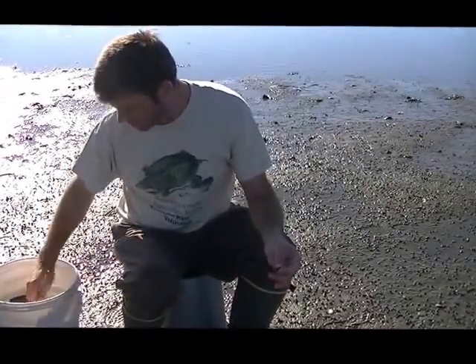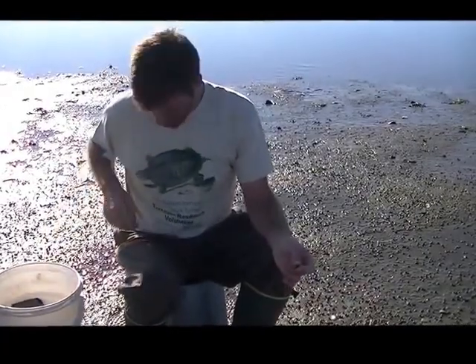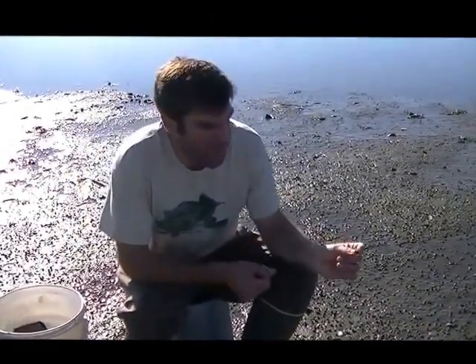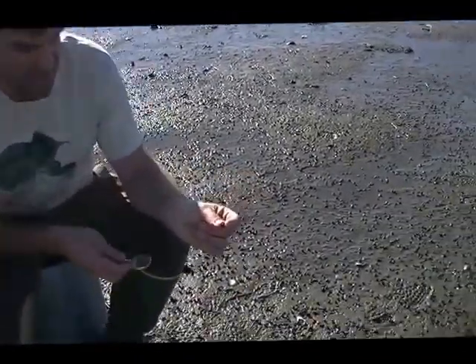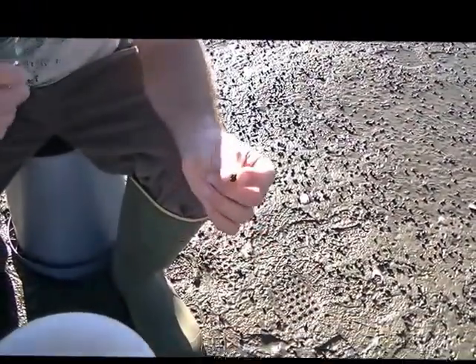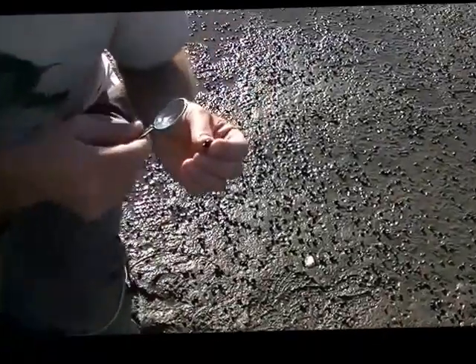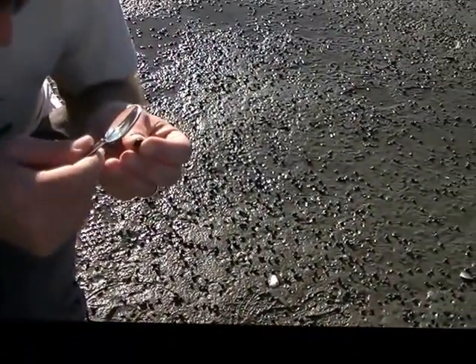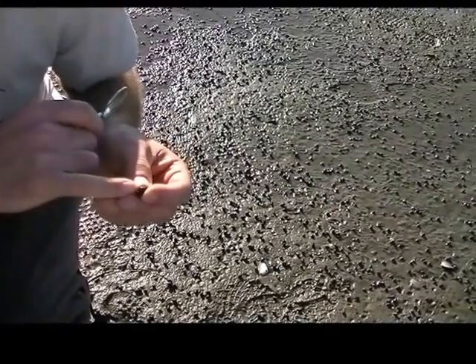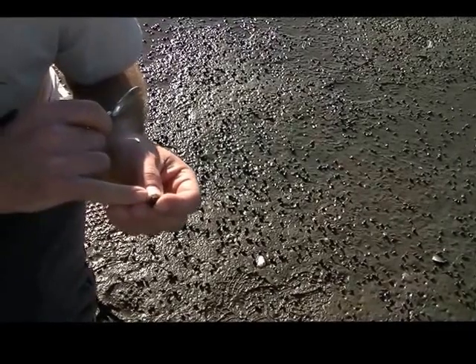So that's all you need in terms of measurements, but now we're going to quantify and determine if the parasites are found on the snails. And so for this, you can use a magnifying glass, or if you have magnifying goggles, you can use that. And what we're going to do is use the magnifying glass and check the operculum and see if that has any cysts on it.